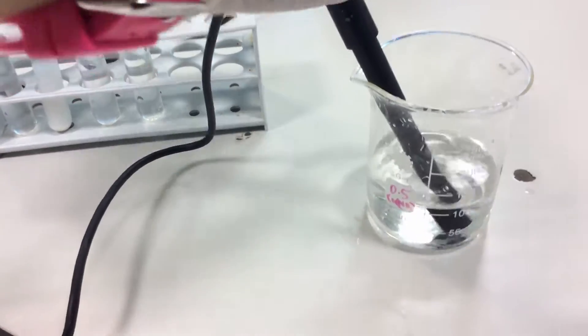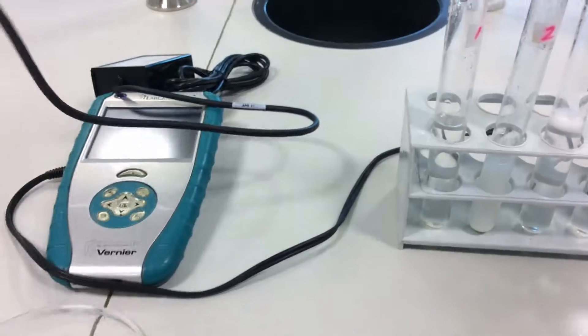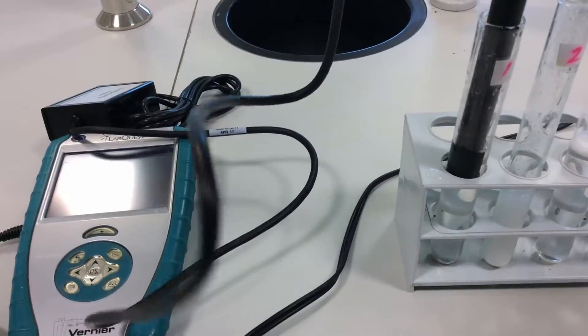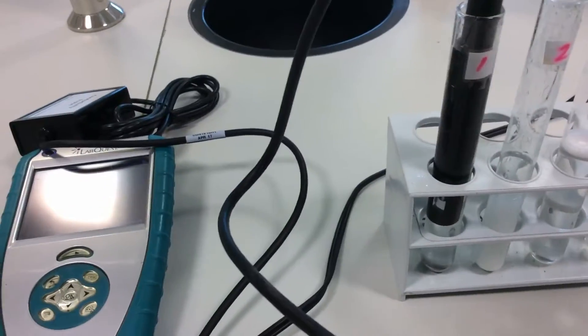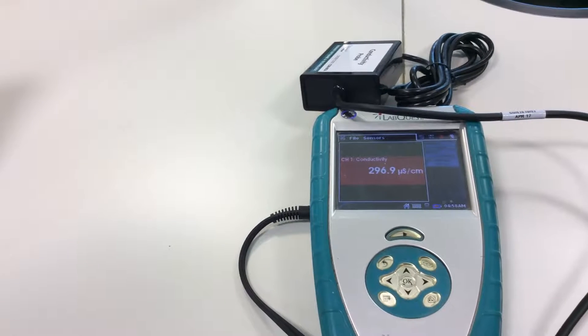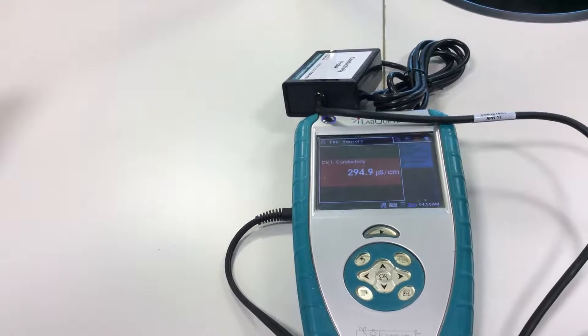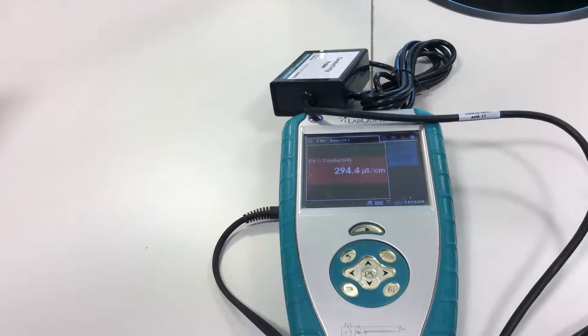So now let's begin and check the conductivity of the first solution. Now I'm dipping it in sodium chloride and this is the recorded value of conductivity. Now I will wash it again.